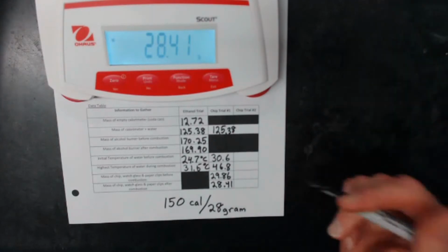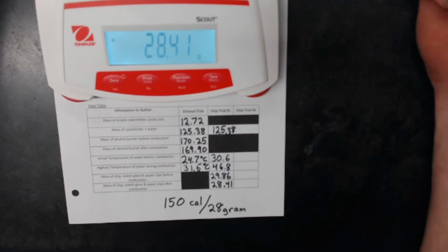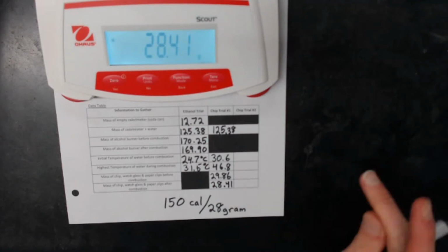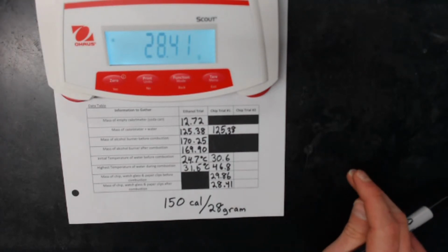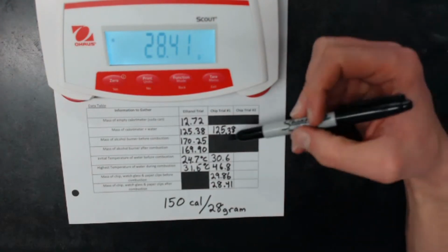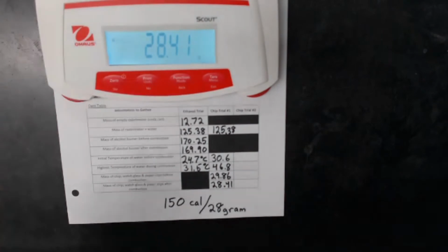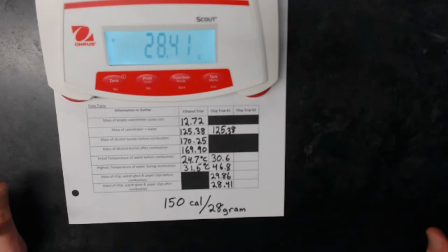I'll come back and give you some of that data when I post this lab out there, but I don't have time to do it right now. Because there's such a great source of error and there's so many different variables going on there, it's always best in science if we take multiple trials and average our results. But as they say in my kids' preschool, sometimes you get what you get and you don't throw a fit.